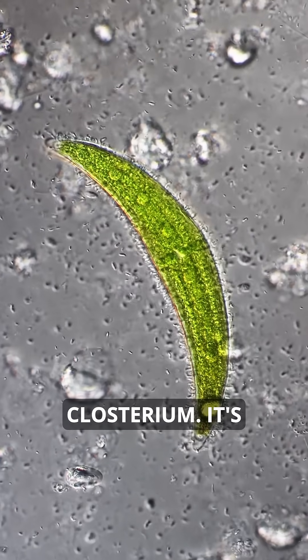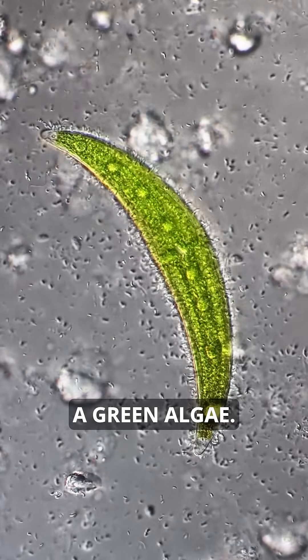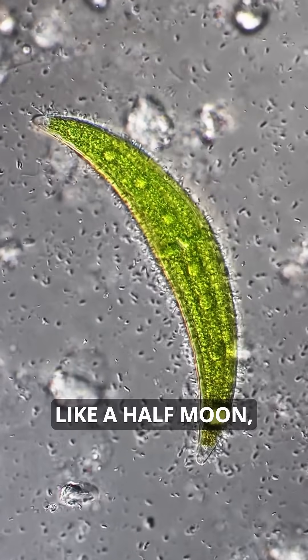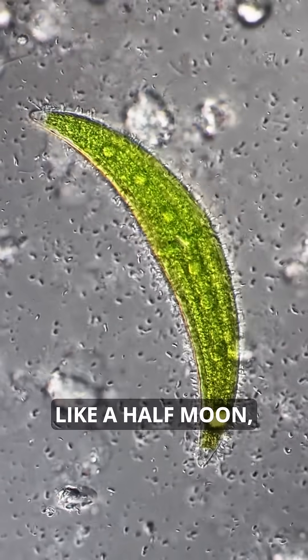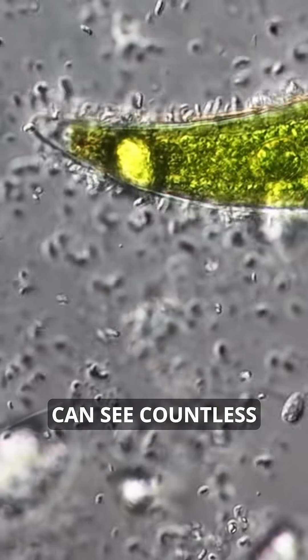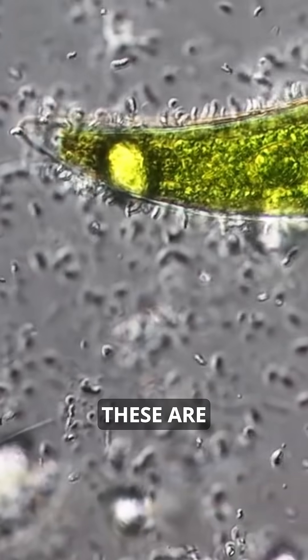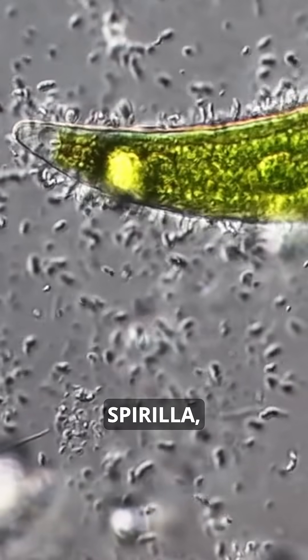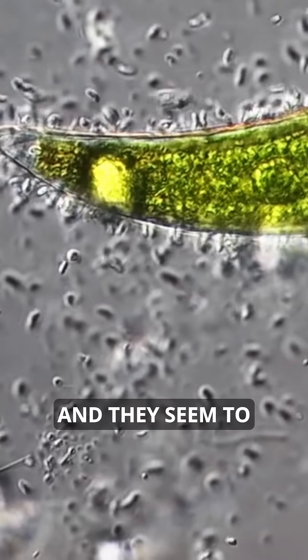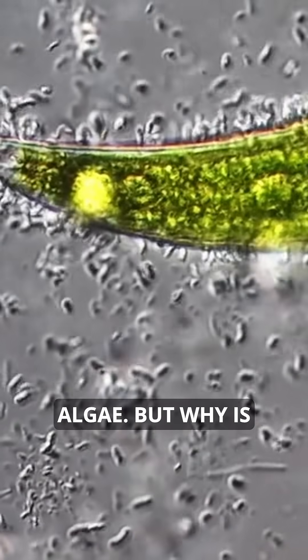This here is Closterium. It's a green algae. It's a beautiful crescent shaped like a half moon, but around it if you look carefully you can see countless tiny bacteria. These are spirilla and they seem to be gathering around the algae and seem to be quite interested in that algae.